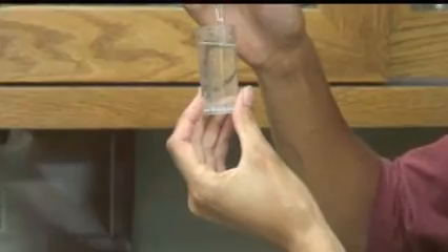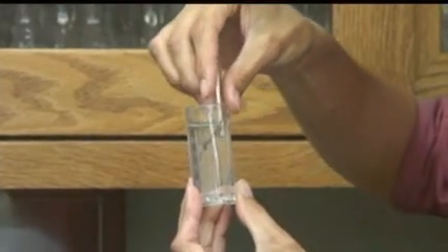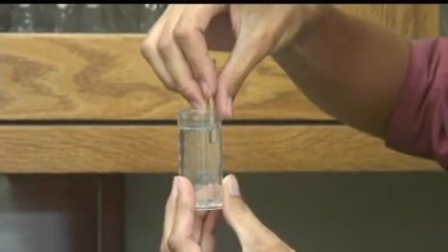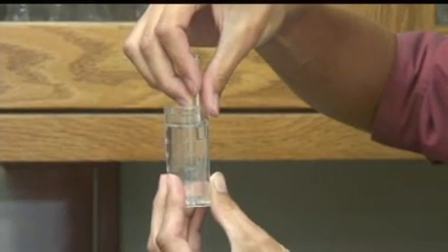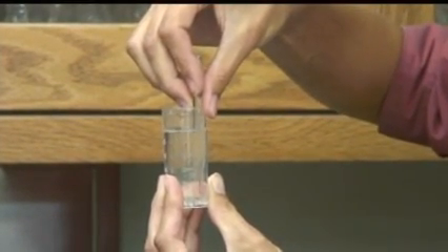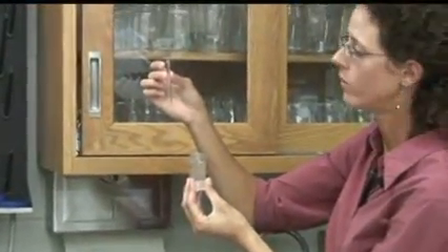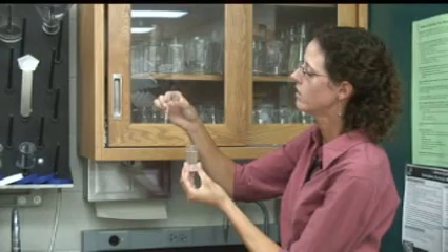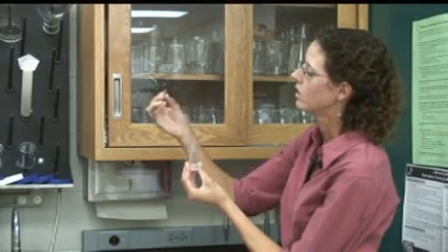On the bottle, there are little scallops along the outside edge. You'll want to set the tip of the vial in one of the scallops and then squeeze back against the outside wall of the container. When the tip snaps, you'll hear it and there'll be a sucking sound as the solution is pulled up into the glass vial. So we snap it off — you can see that the tube is now full. Then move it up and down and mix with the bubble.